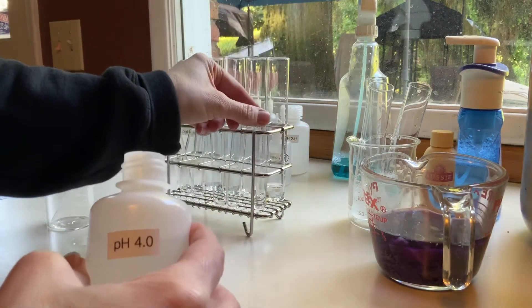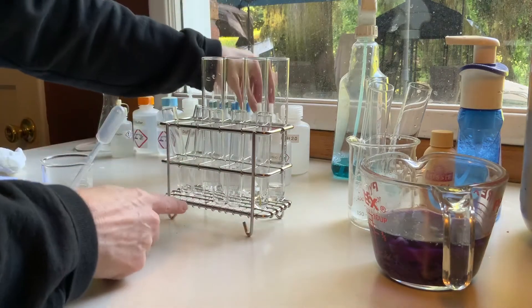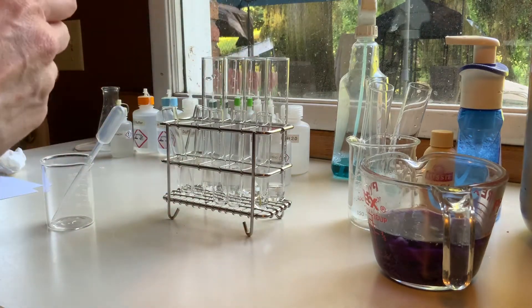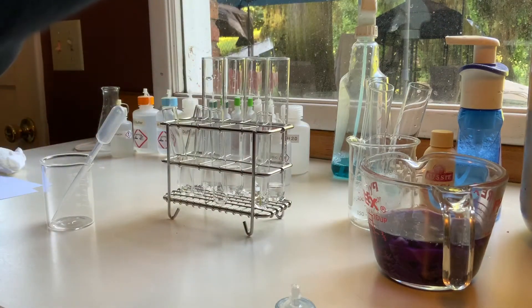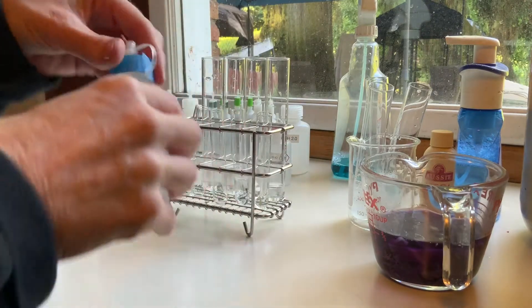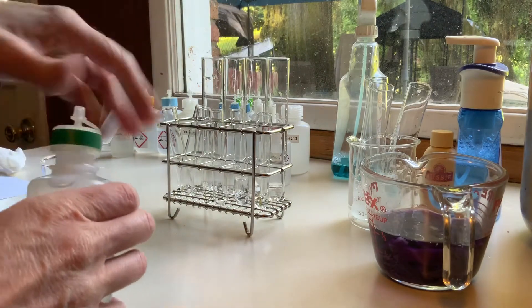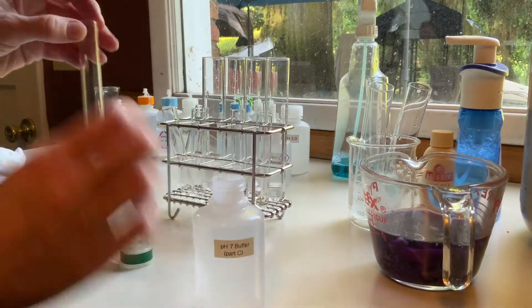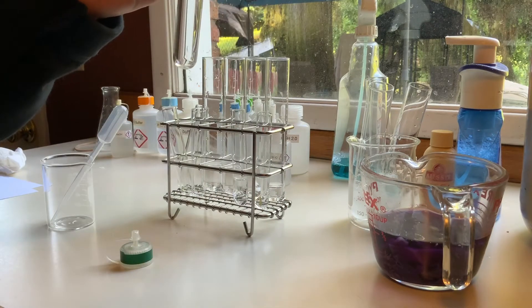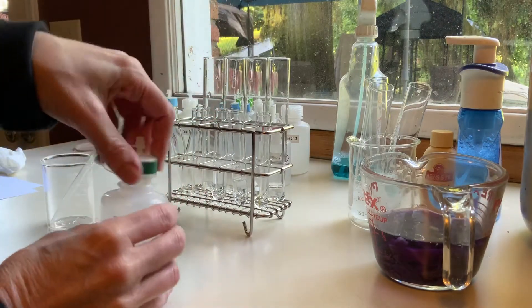Mainly we want to get a nice uniform color that we can see. That's 2, 4 — I'm going to go along the front here. 6. This one has a dropper but I'm going to go ahead and just fill them up to relatively similar amounts. This is 7, so we've got 2, 4, 6 — and then right through the neutral range we will add that extra 7 which is neutral.